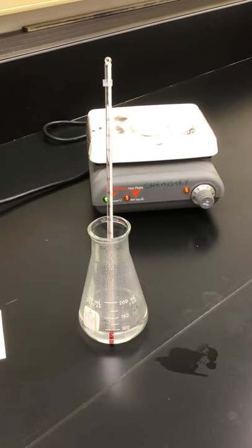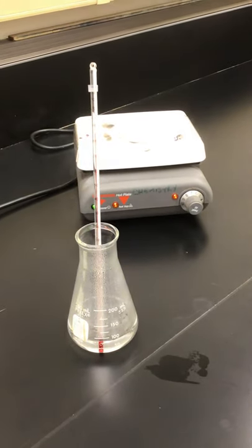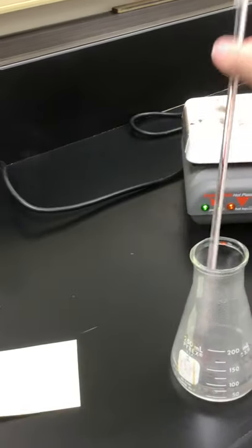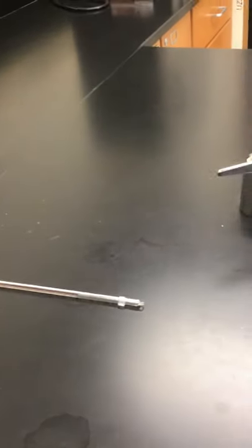All right, our solution is now about 85 degrees, and so we are going to begin our titration.